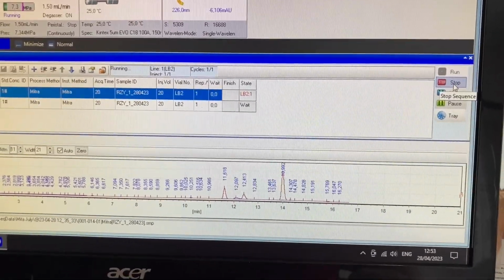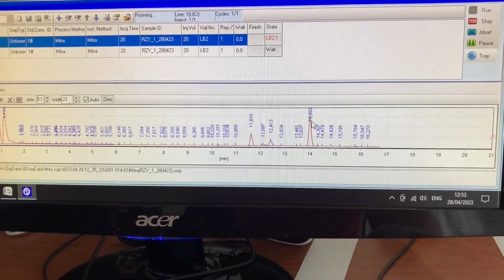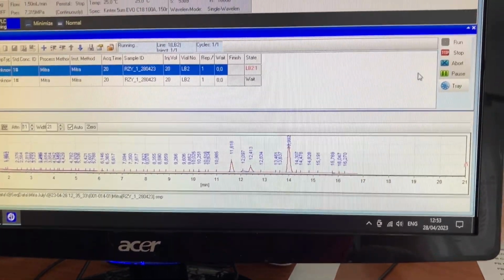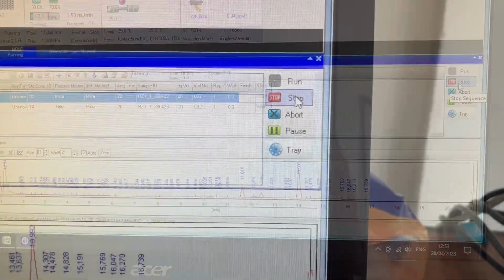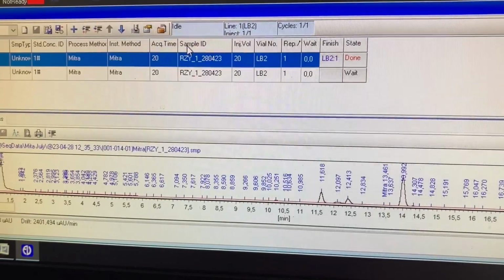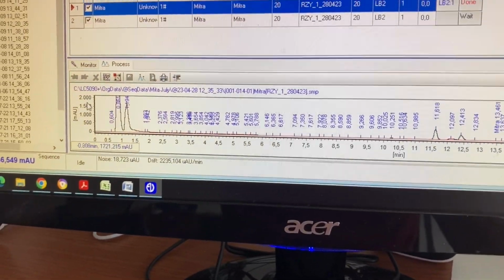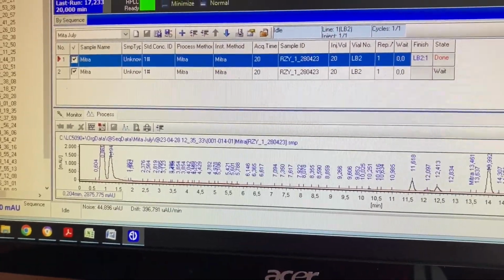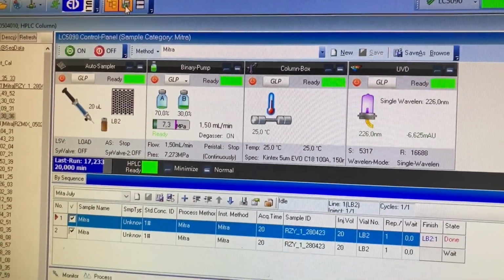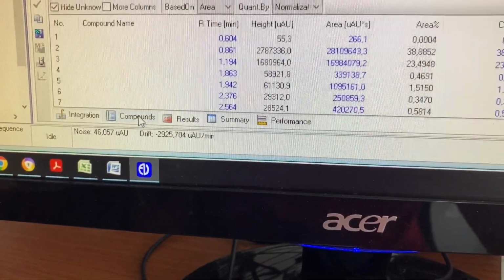Or stop it before the end of the run because you're confident that you've got the peak and everything's going to come together. Over here and stop it. Yes, we stop it. Then get rid of that, and go down here to compounds.